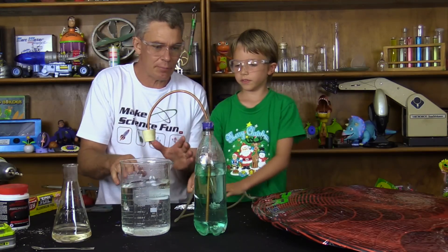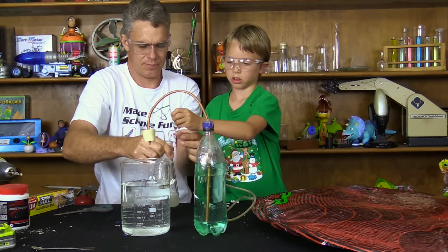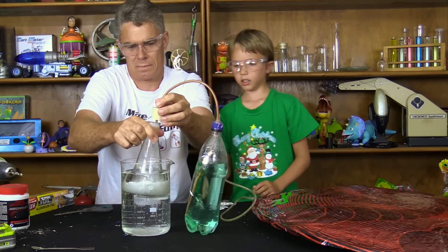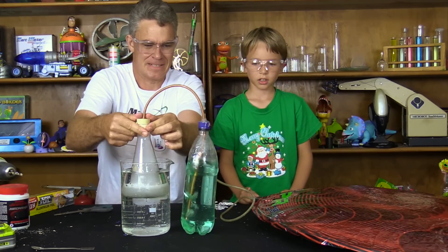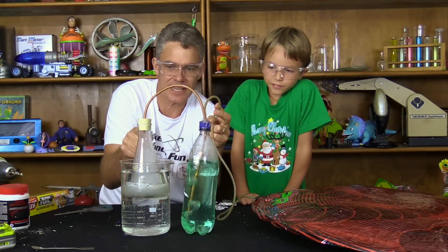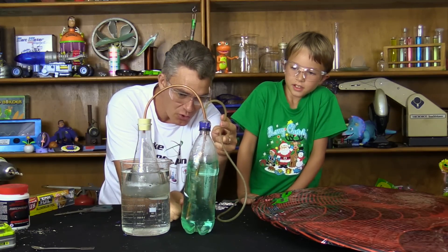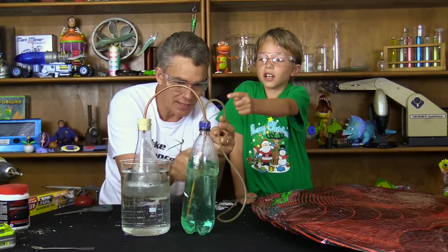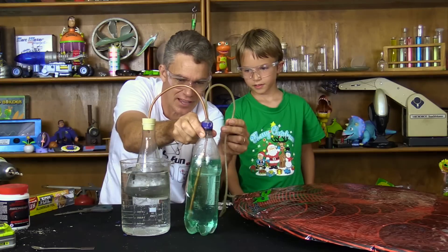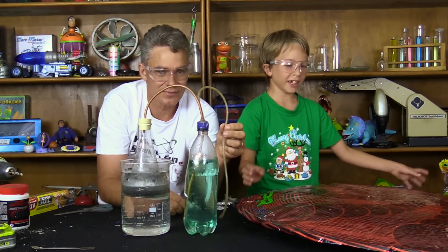Alright Sam, I've modified the setup to make it a bit safer. Let's put the aluminium foil in here quickly. The hydrogen gas is coming up here, up this tube, down into the water, and it's bubbling through the water this time. And then it goes up and in here. Oh, it's getting bigger - much safer. We also cool down the gas a bit. Oh, it's so big!